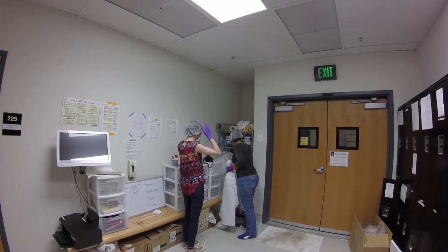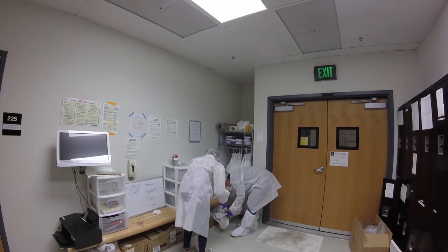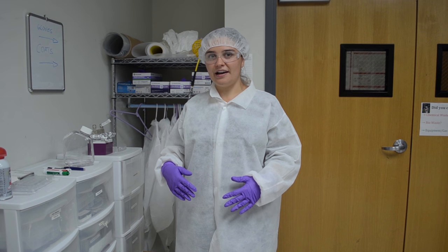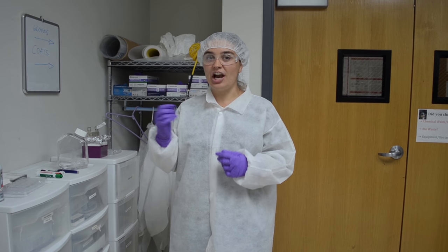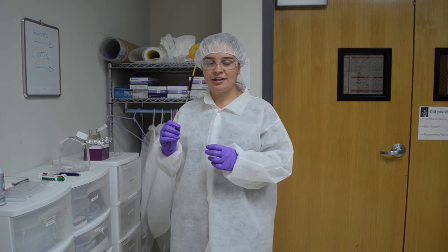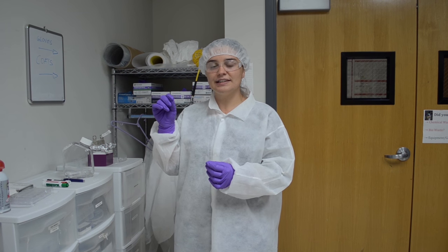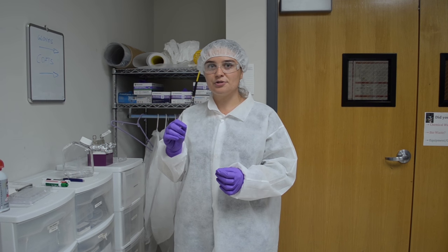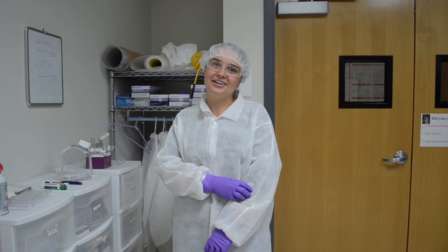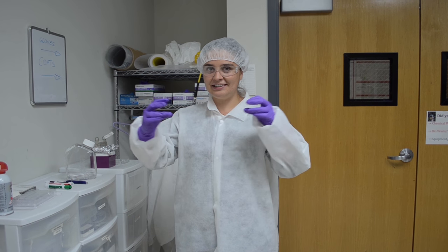Why are we dressed so funny? Because we want to restrict the number of particles that go into that clean room area. It's basically anything on your clothes, like lint, will be giant in comparison to the things that we're making in there. So we're making things that are smaller than your hair. Your hair is 80 microns. We're making things that are like 1 or 2 microns, so basically like 100 times smaller than the width of one of your hairs. So if you get a hair on your device, you're going to be really sad. It's just going to be like this giant hair.